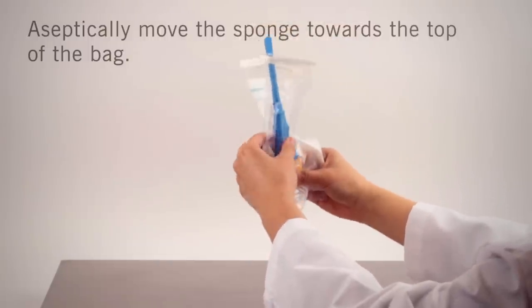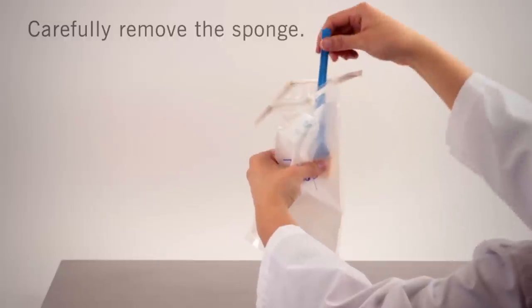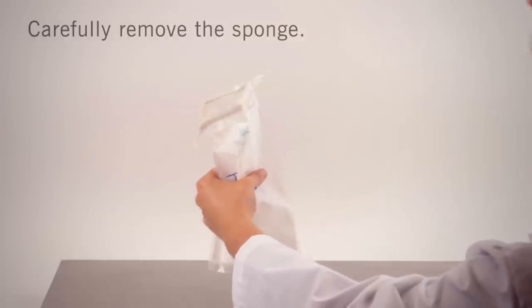Depending upon your food safety requirements, stick sponge may be used with or without gloves. Carefully take stick sponge by the handle to remove from the bag.